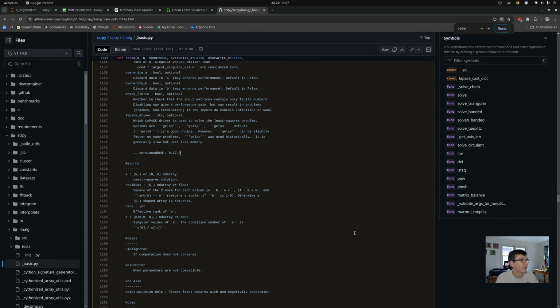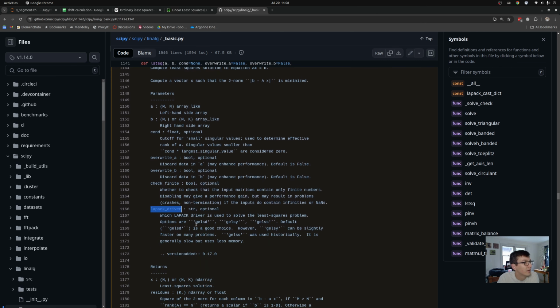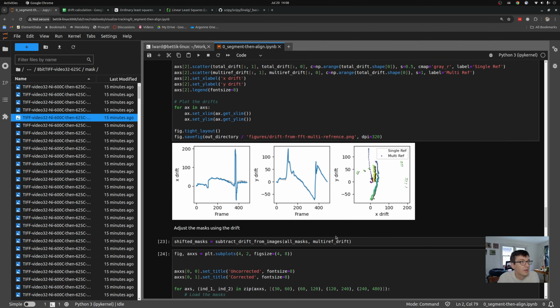So you can see here, and I'll show you where this looks like inside of the SciPy source code. You'll note that it has a LAPACK driver that defaults to a code called gelsd. That's actually corresponding to a Fortran routine that solves, yep, here it is, that solves this underdetermined linear least squares problem using a numerically efficient technique implemented very well, which allows me to solve my linear systems of equations problem very quickly.